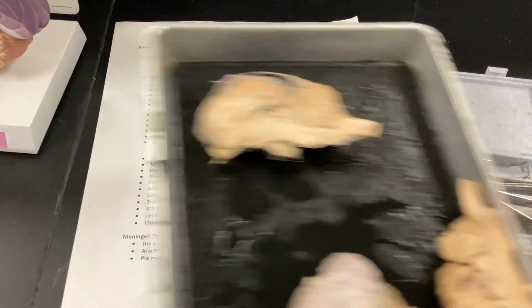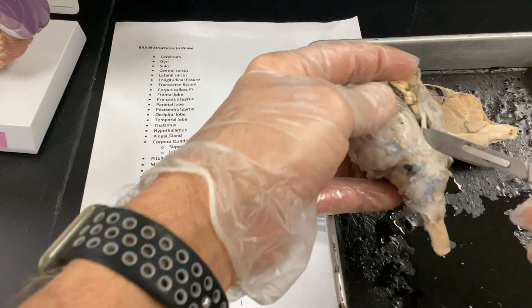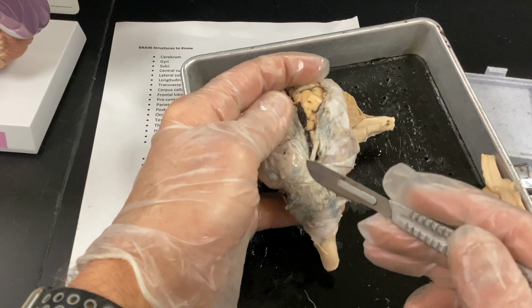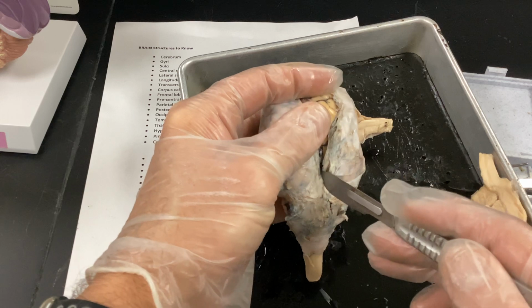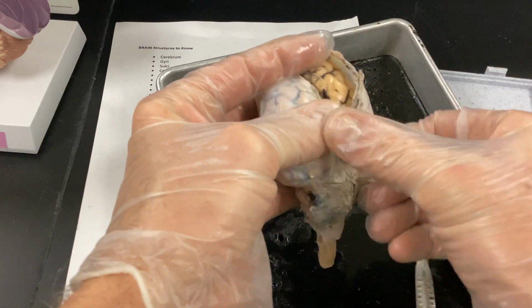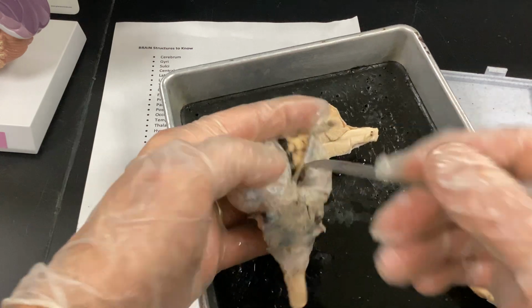But anyway, I'm going to bring this back in here. Sorry for the mess here, but I'm going to try to cut it not looking into the computer, so I don't know if I'm going to be in line with all that. But I just did a really superficial little cut.